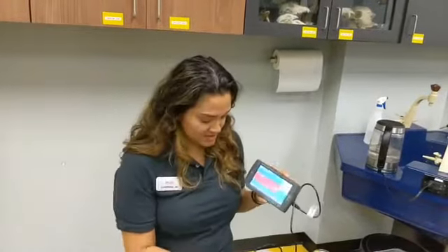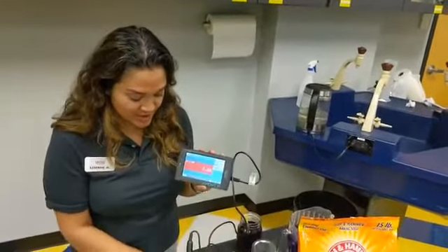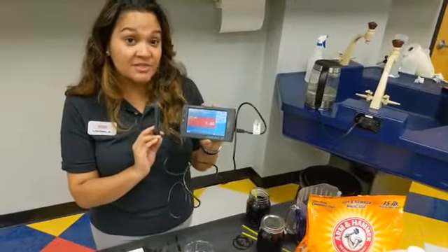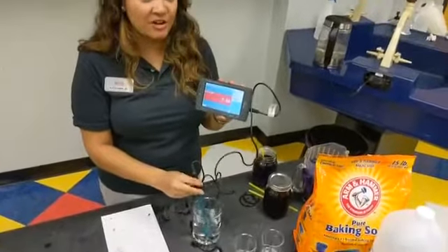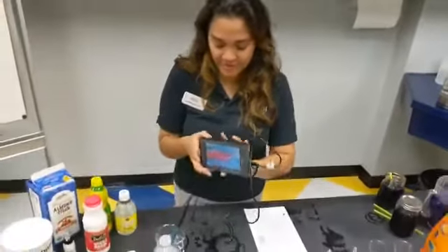Okay, so our water here, which is distilled water, is a 7. So we're going to assume that that's our known value. We already know that. Many scientists have figured that out, and that's what we're going to start with. Our probe is right here. We're going to be dipping this probe into all of our samples. In between each sample, we're definitely going to rinse it off in our water here so that we're not cross-contaminating any of our samples. All right, so start back over here.